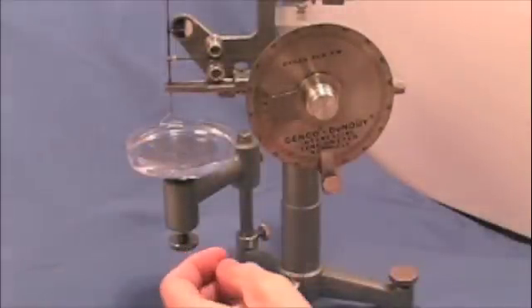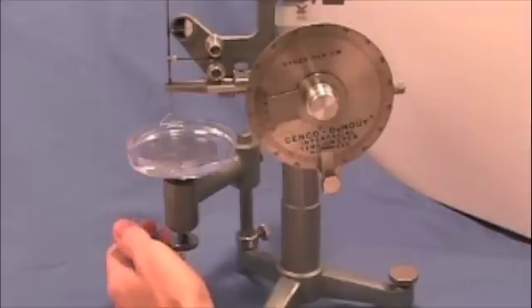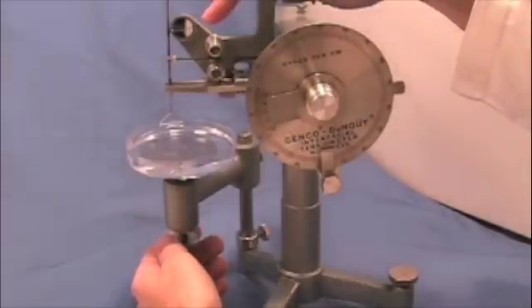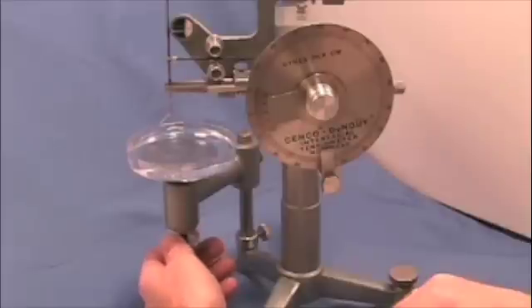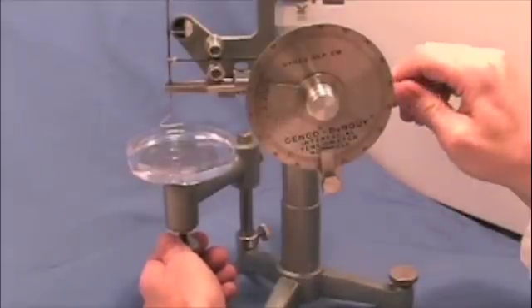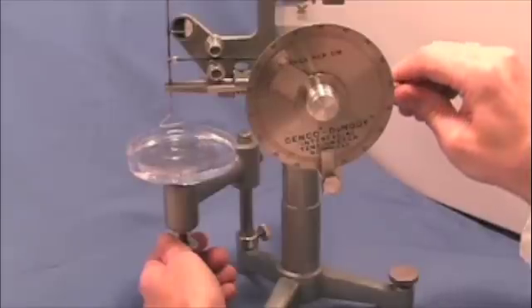We're going to do a test here for surface tension on distilled water. We're going to lower the table to the point where the needle starts to be deflected from the surface tension, lowering it so that the ring becomes closer to the surface of the water until we see it starting to deflect the needle because of the strain. It's starting to move now on the right hand.